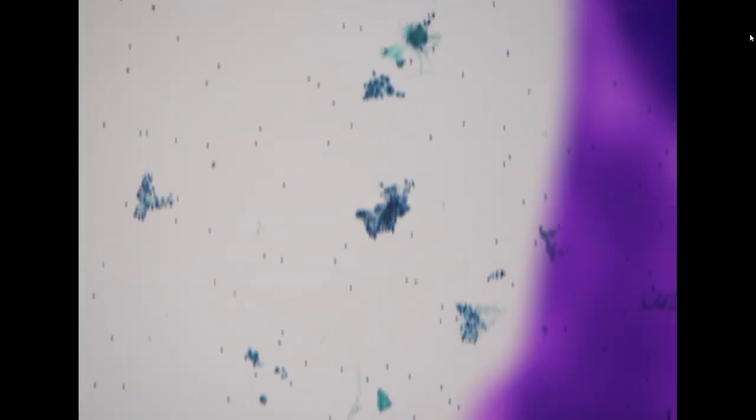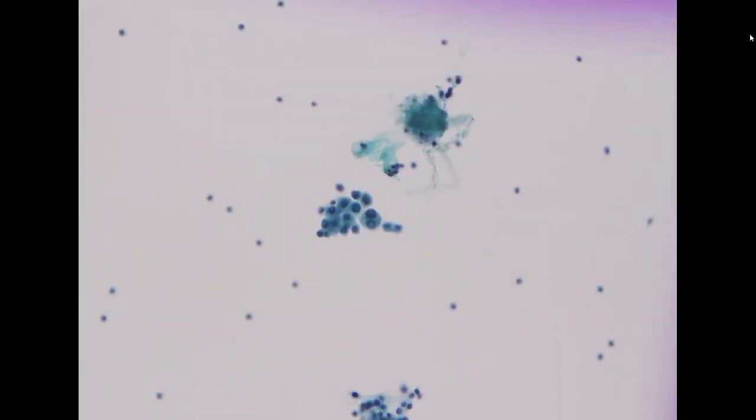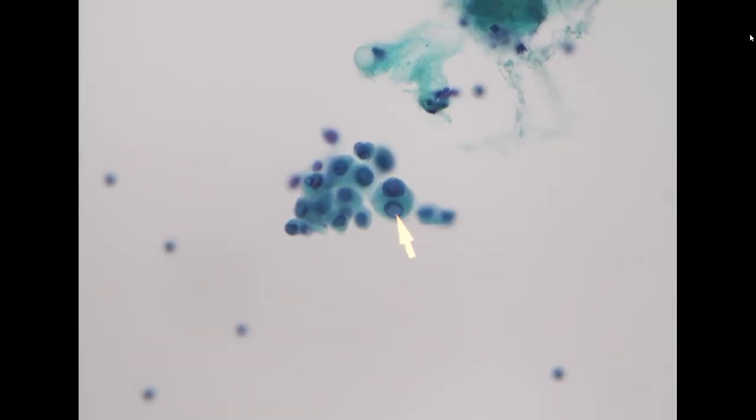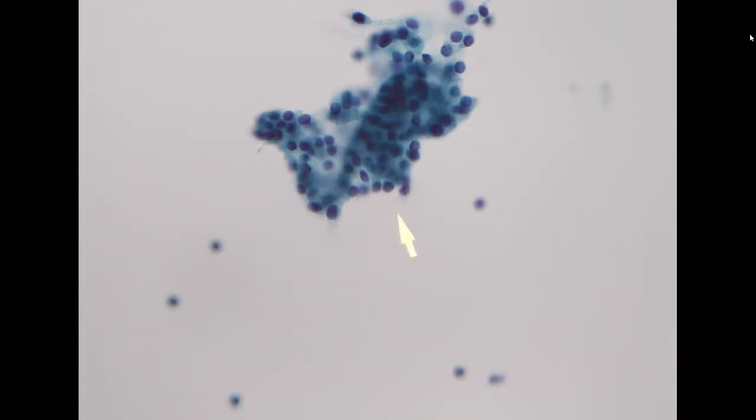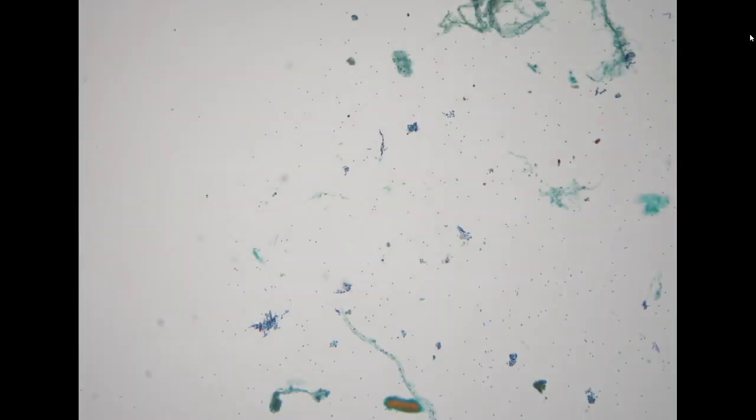So it is important to screen the entire specimen because on rare occasions like this, the sampling technique can mix two different components, papillary thyroid carcinoma as well as benign follicular cells. Sometimes the PTC area could be really scant. So you need to screen the entire specimen thoroughly to identify the malignant component.